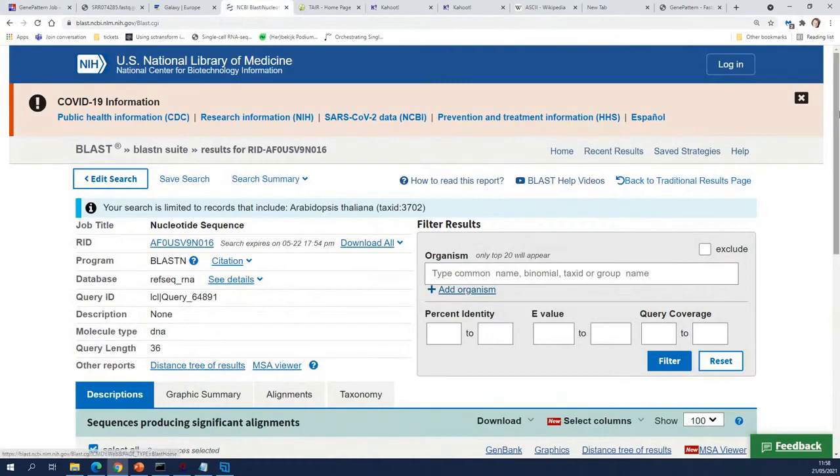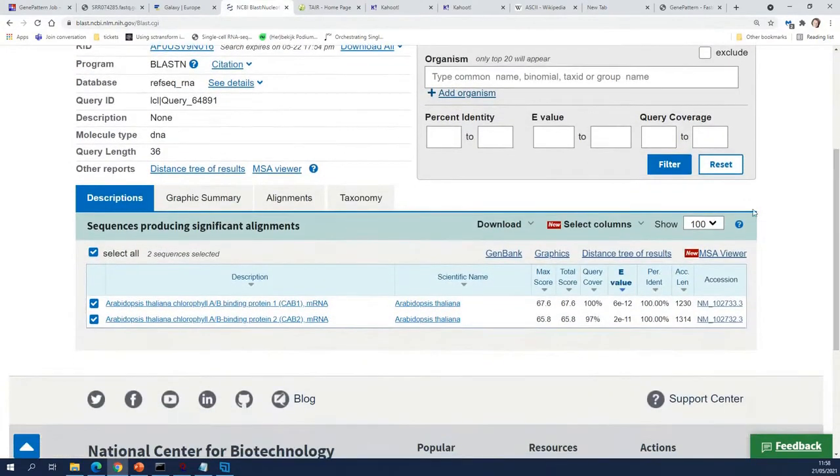Look at the BLAST results. It's a Chlorophyll A-B binding protein, 100% identical over the entire length, so that is the one.